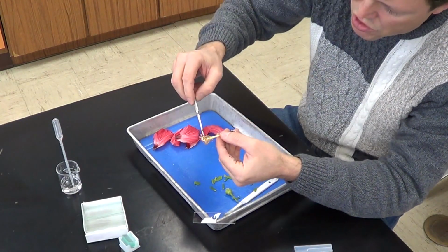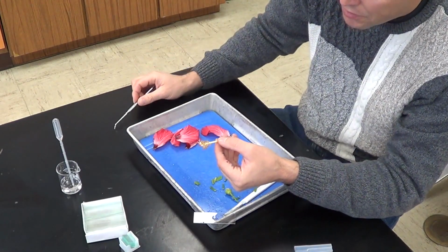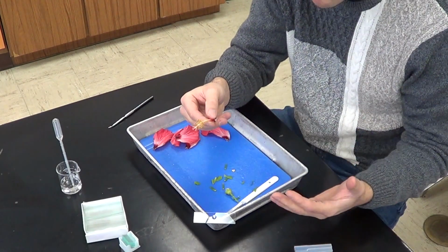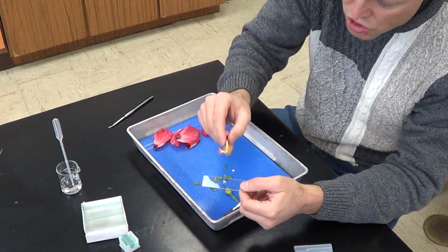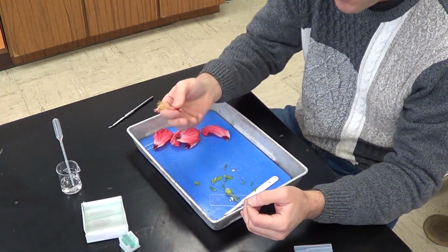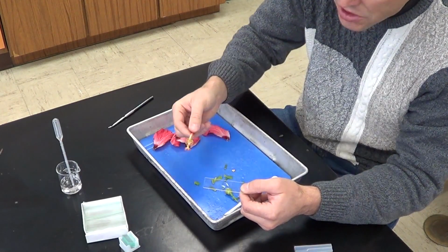And remember, these yellow structures here are the male part of the flower, especially up here. These are called the anthers. And the anthers contain pollen, actually make pollen. And what I want you to do is just take it gently and strike it 3 times in the water, very gently. We don't want to get all kinds of other plant materials and debris in this water drop. So 1, 2, 3. And that's going to be enough.